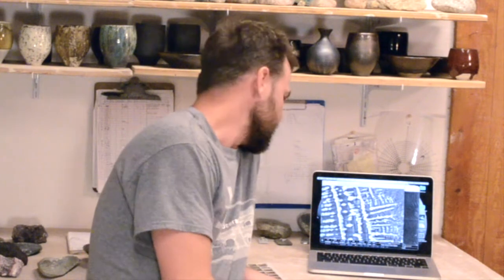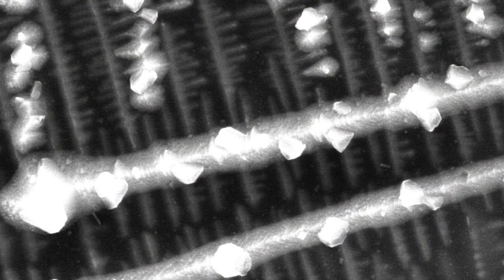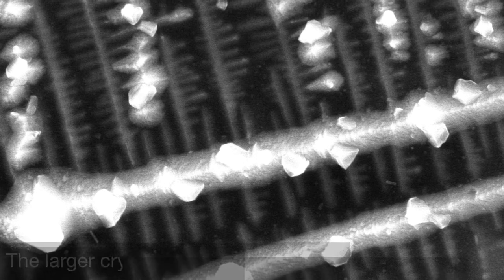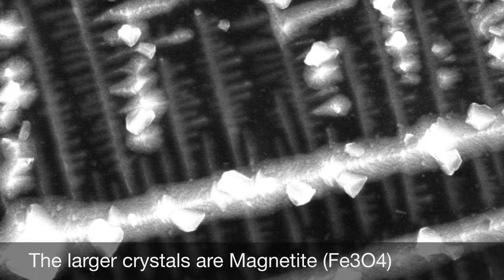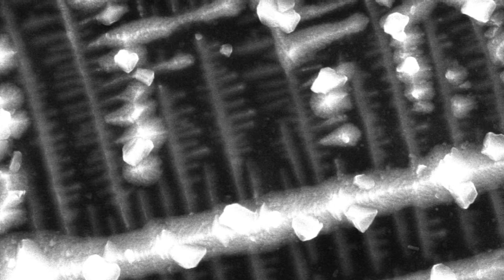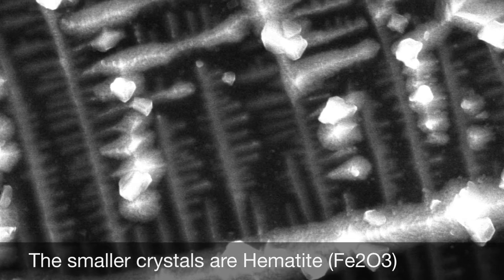So what's going on with these iron crystals is that they will actually grow in rows and columns. Because as you move away from your highest concentration of iron outwards to lower and lower concentrations of iron, they'll actually take the path of least resistance.